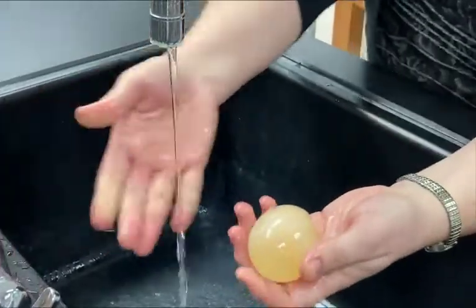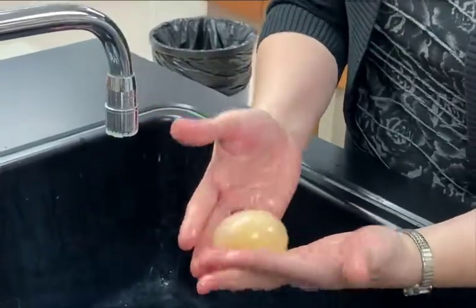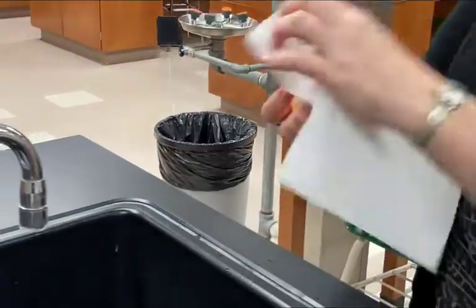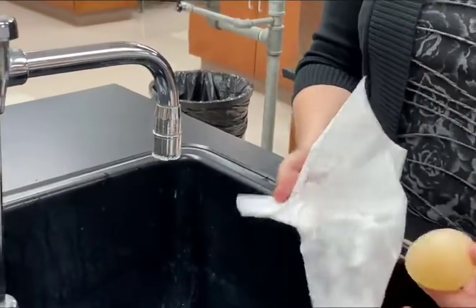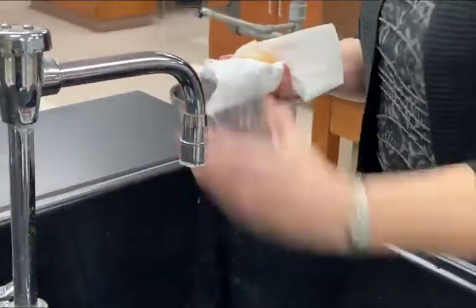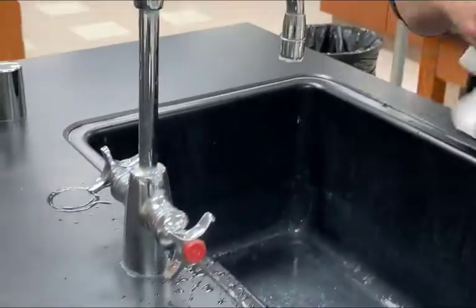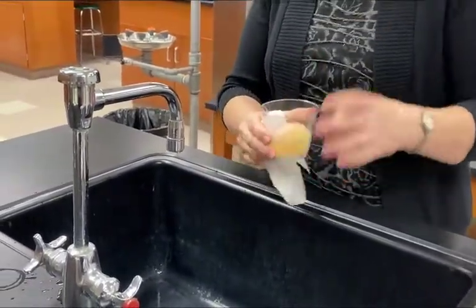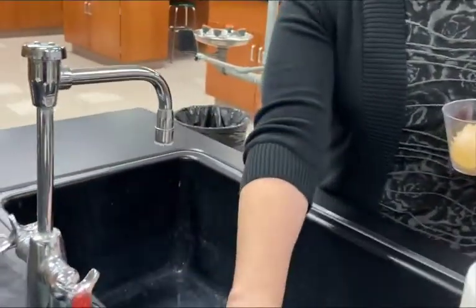She's finishing up right now and she has all the shell off. Excellent job. Now you're going to get a paper towel and dry it off a little bit. Then take the cup that it was in, rinse it out if there's any vinegar in it, and dry out the cup. Before you leave the egg, we had to let the egg kind of air out for a day.